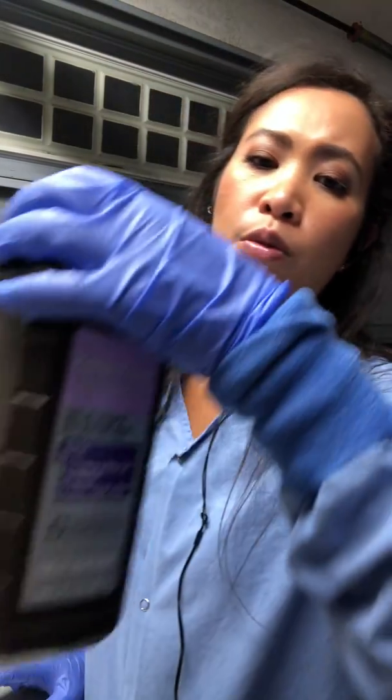So the same thing with this experiment. We were asked to go ahead and inoculate bacteria and smear it on these glass slides. After smearing that, we were asked to go ahead and add drops of hydrogen peroxide onto the slide and see if it bubbles, and it did. So both bacteria are positive because of the bubbles that I saw. And it said if the bubbles are not existent, then the result would be negative.